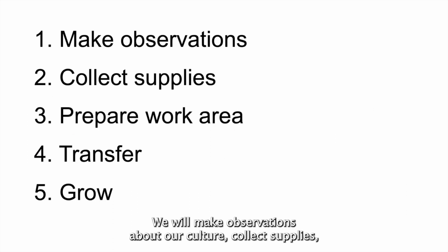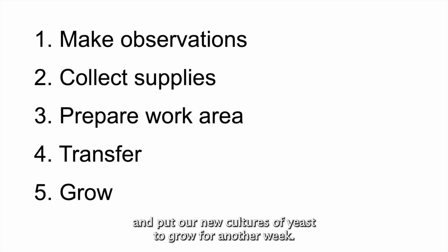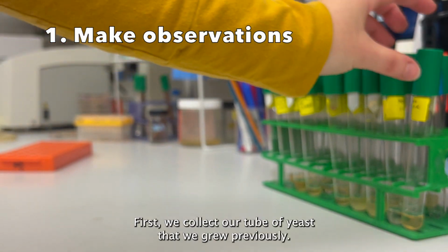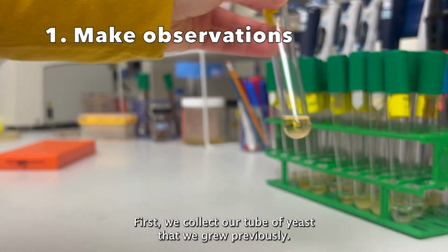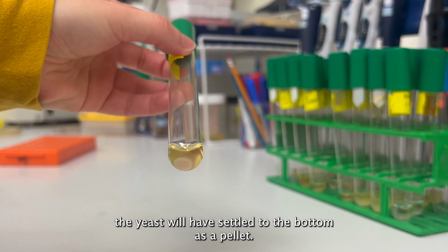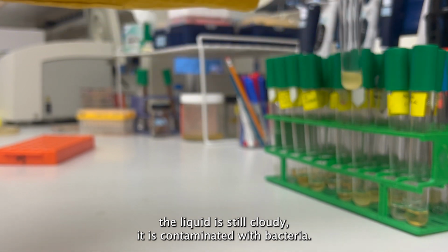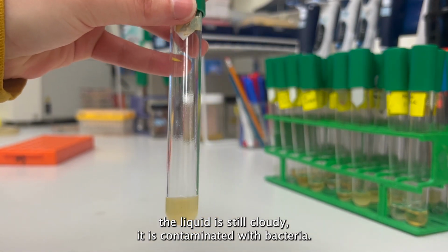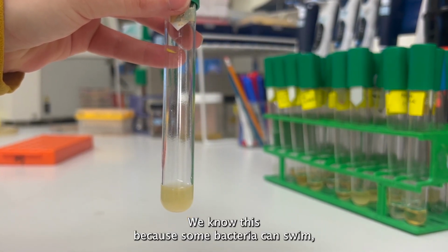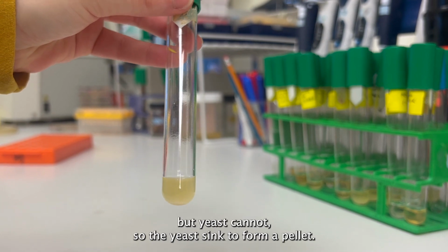We will make observations about our culture, collect supplies, prepare our work area, carry out the transfer, and put our new cultures of yeast to grow for another week. First, we collect our tube of yeast that we grew previously. If the tubes have been sitting, the yeast will have settled to the bottom as a pellet. If, after sitting for an hour, the liquid is still cloudy, it is contaminated with bacteria. We know this because some bacteria can swim, but yeast cannot, so the yeast sink to form a pellet.